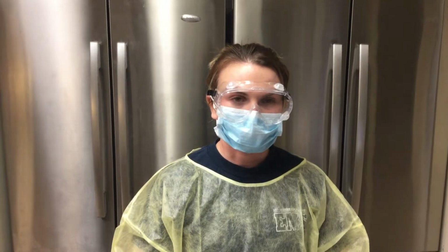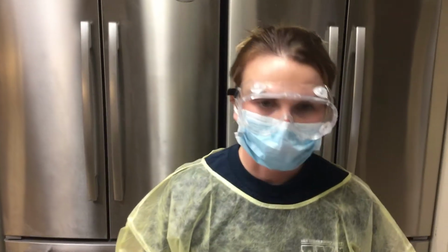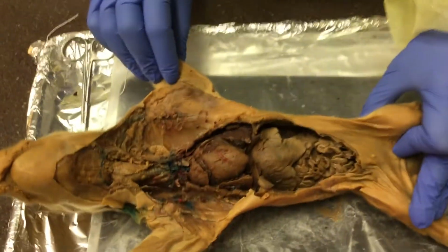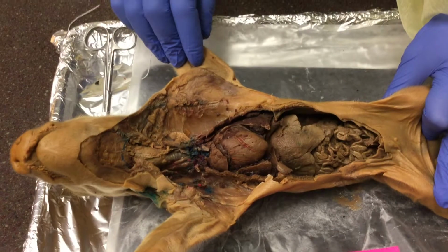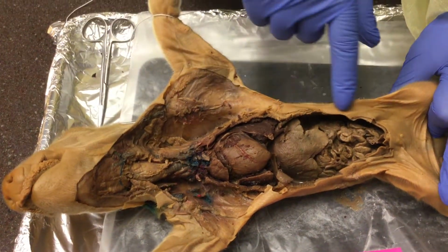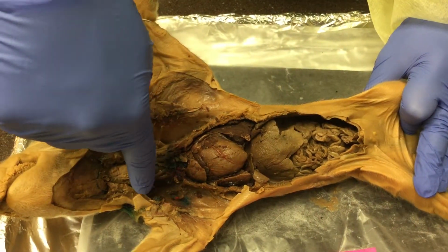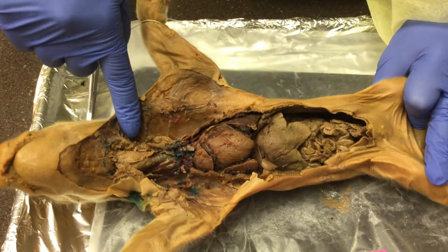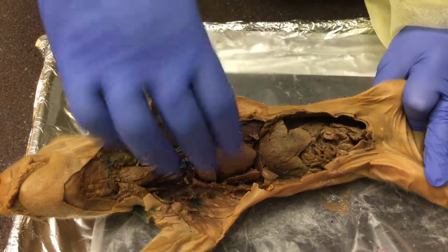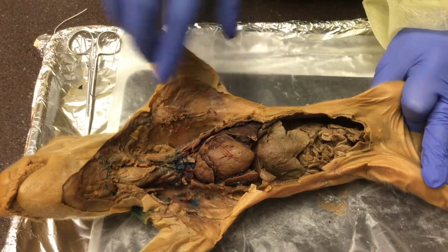Today's date is January 28th, 2018, and this week we're doing the dissection of the fetal pig. For our dissection, we had to cut through all of this skin, carefully not cutting some of the arteries and veins that we're supposed to be looking at. We also removed the rib cage in order to get a better visual of the heart and lungs.